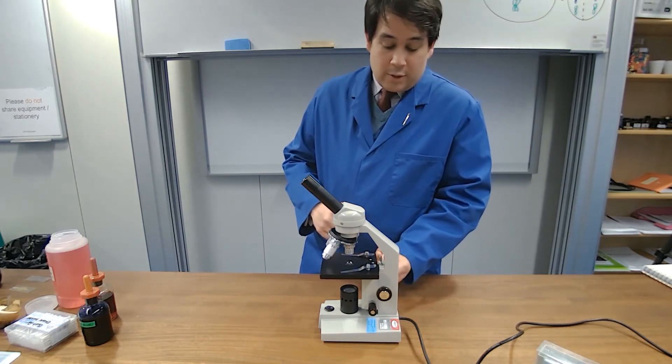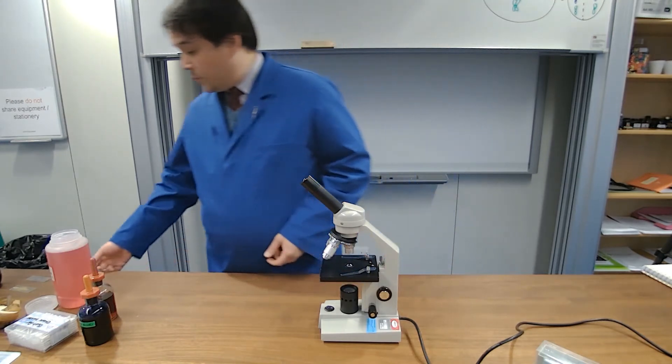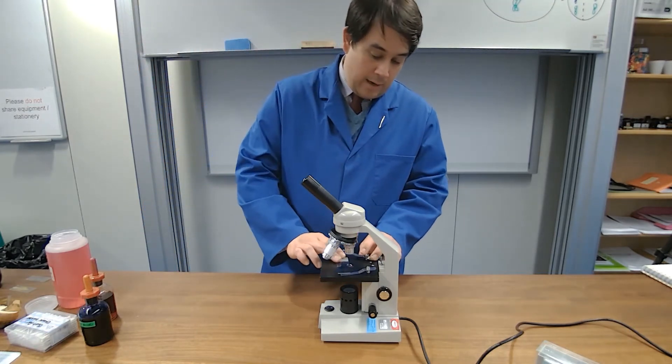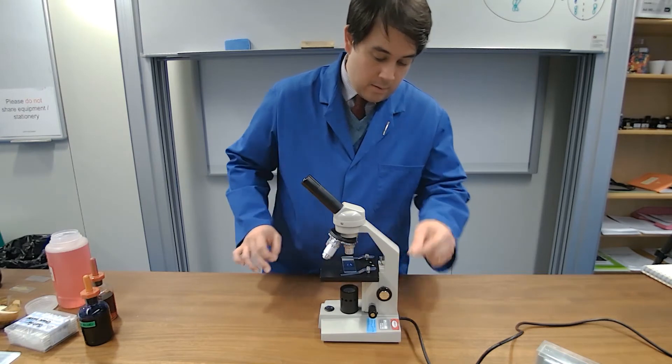So the best thing to do is to lower that first, lower the stage, we then put our slide onto the stage and then clamp it as such.